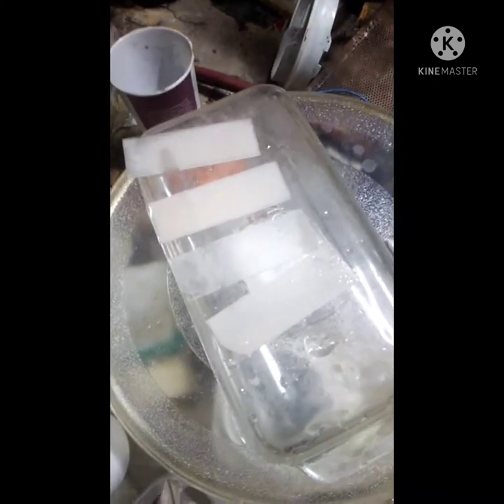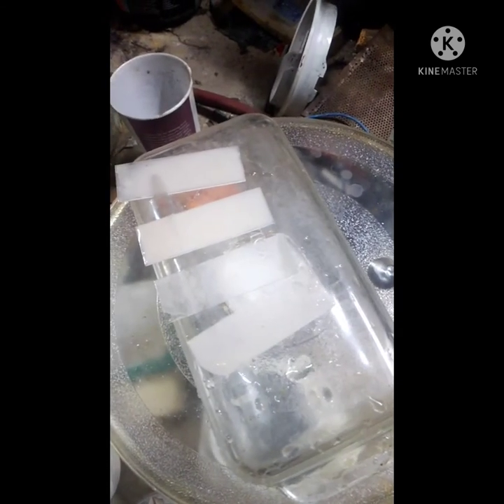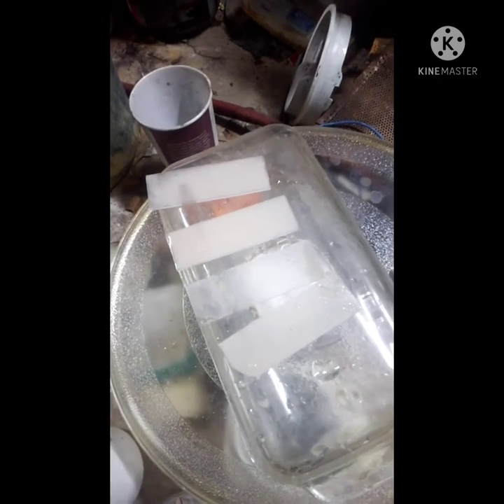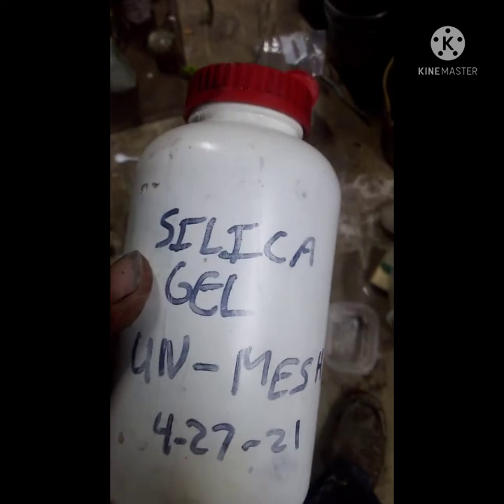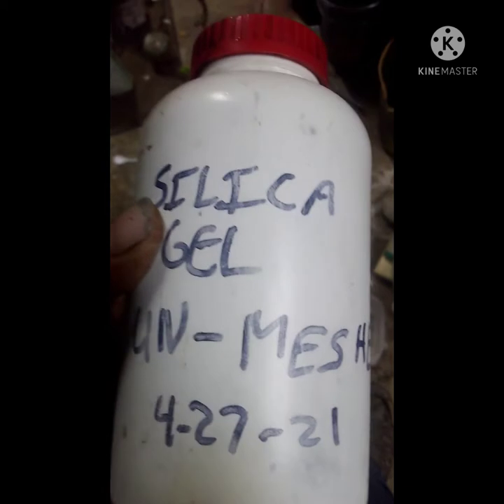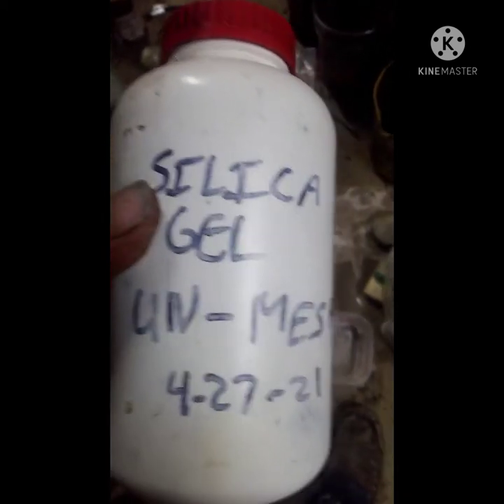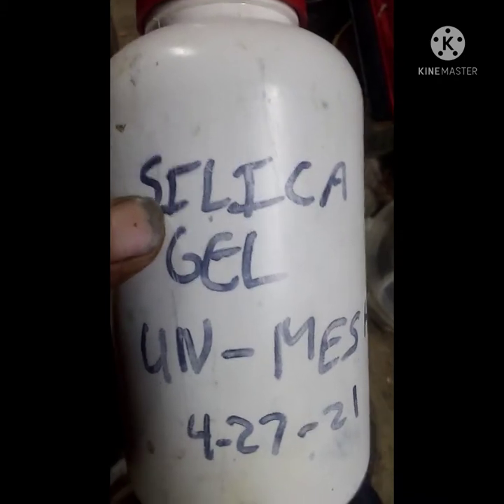I'm going to throw two of these in the oven at about 120 degrees, and it'll probably take an hour or two to dry. One important safety note about silica gel: it's very dusty and the dust is very bad for you — it will give you silicosis. Be careful around this dust; it will seriously damage your health.